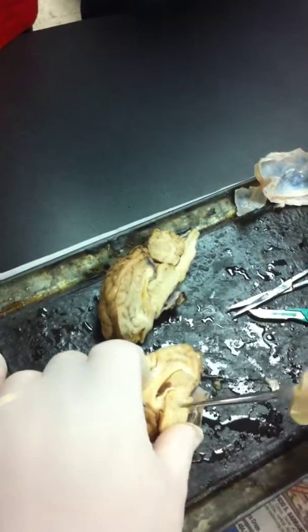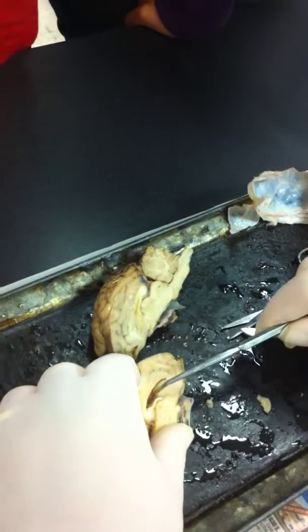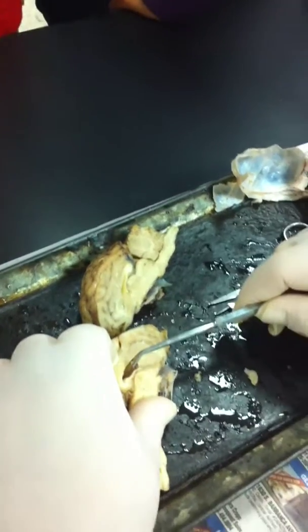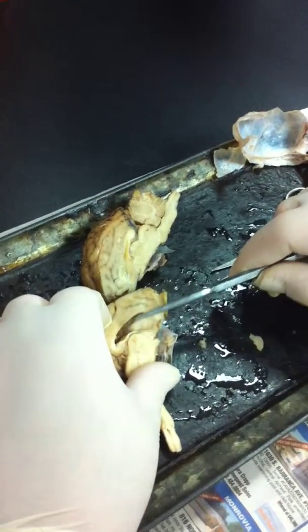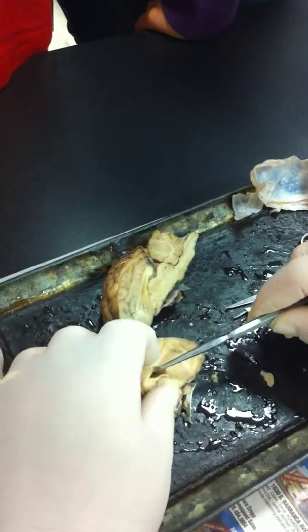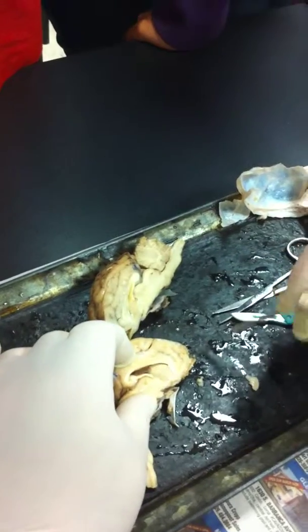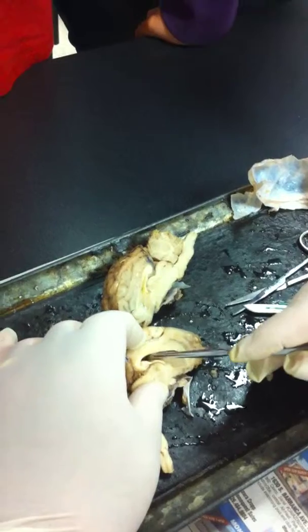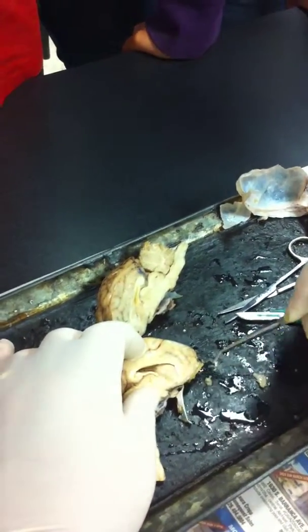Okay, this one has no septum pellucidum; it is either on one side or the other. There's no septum pellucidum here, so you can see the lateral ventricle better. See? See this brownish stuff here? Anybody have a guess as to what this is? See this? I told you yesterday that there would be brownish stuff in the ventricles. What turns brown?